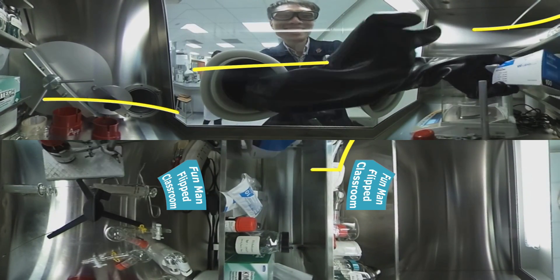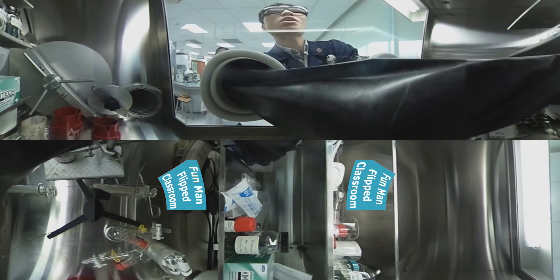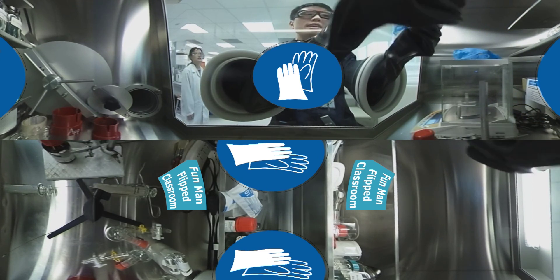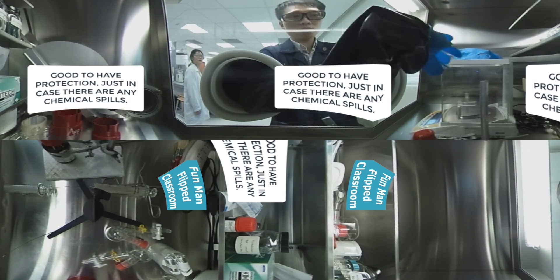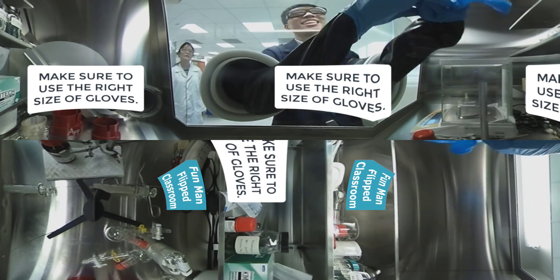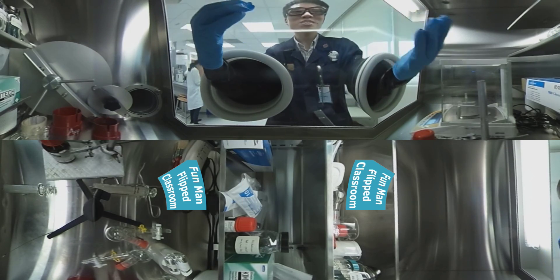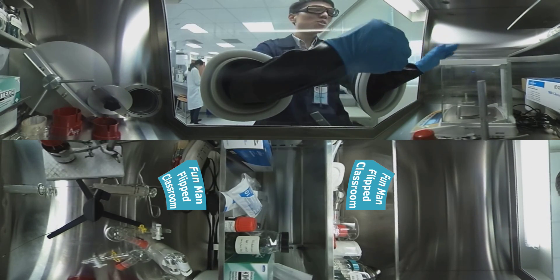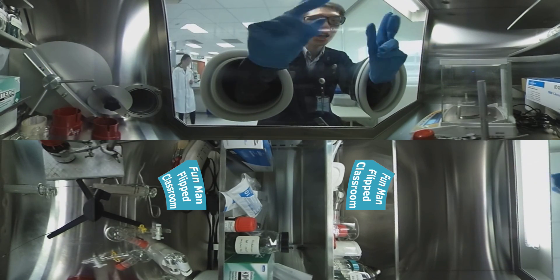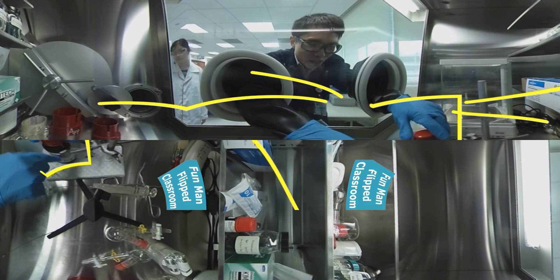The first thing to do is to put on a fresh pair of gloves. Although my hands are inside the latex gloves, we need more protection for these black gloves. Think — what if we puncture them or there's a chemical spill? We always prepare several sizes of gloves inside the glove box. Now you see I've worn the L-size gloves. Ensure you have dexterity — make sure your fingers are moving freely.